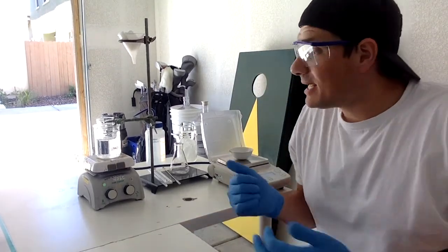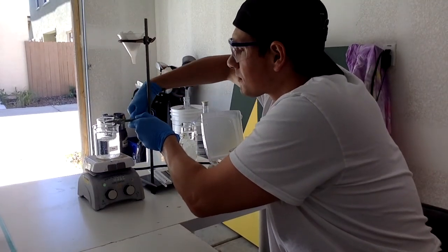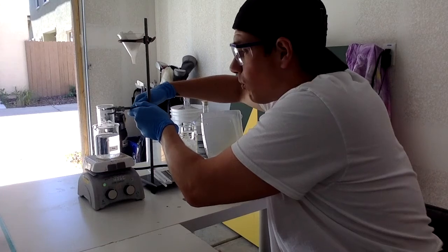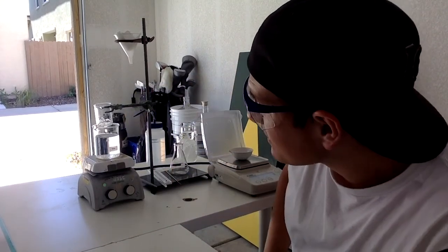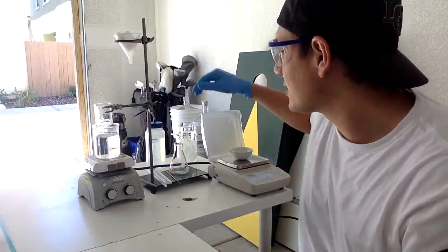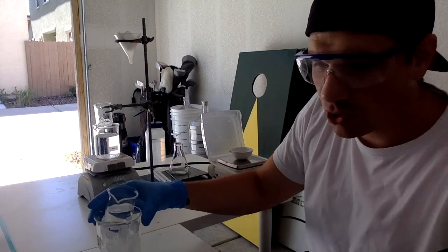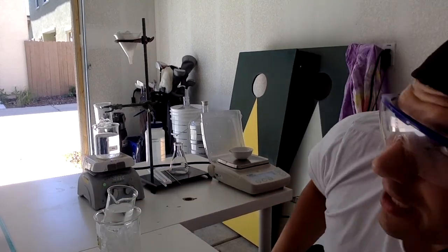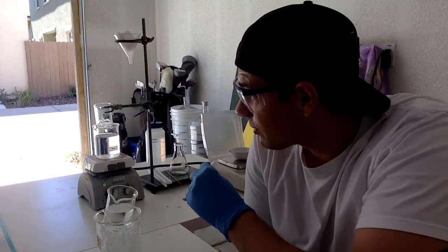What I'm going to do is take this beaker and raise it out of the hot water here, and I can see that the salicylic acid is dissolved up in there. The entire time, I've had this water cooling over here, and I'm going to put a couple milliliters of water into the flask.